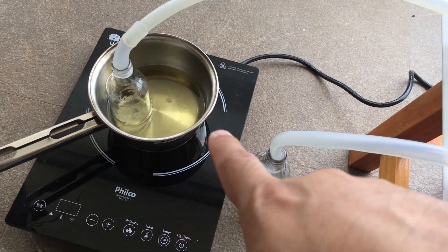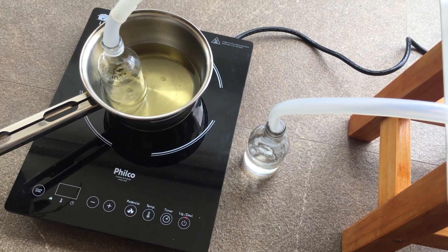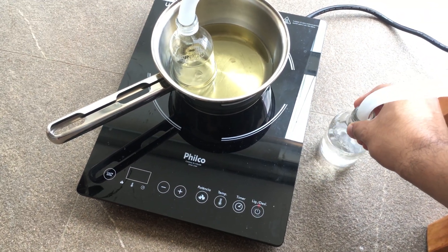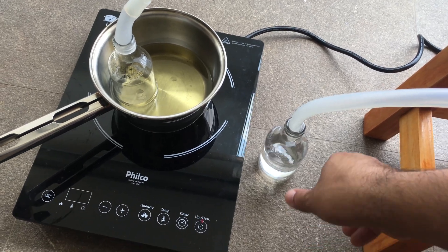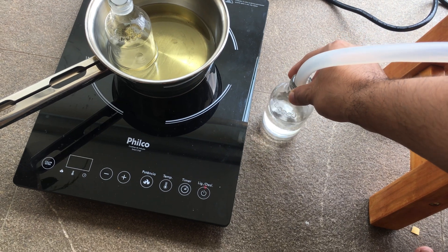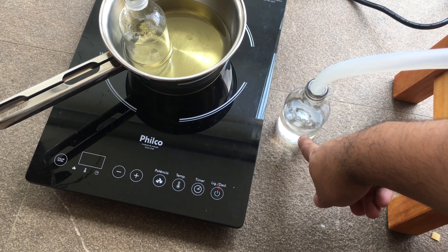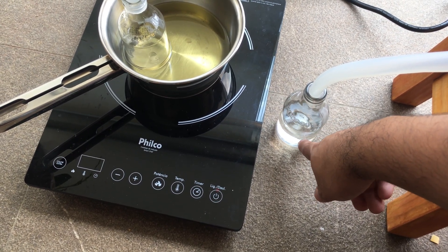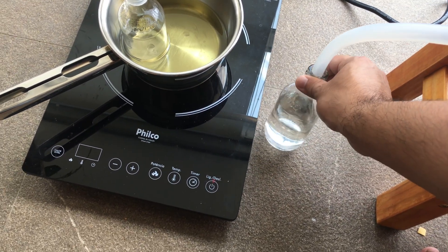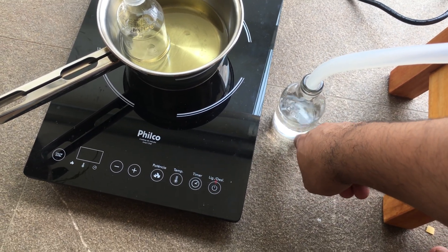This is a very simple distillation that anyone can do — either for purifying crude ethyl acetate from nail polish remover, or to clean up ethyl acetate that's been used for several extractions. After around 10 to 20 runs it tends to pick up coloring and salt impurities, so you can always distill it and get back very clear ethyl acetate.